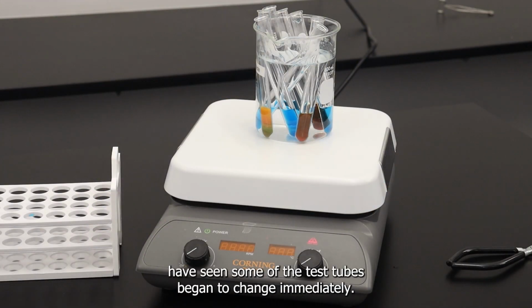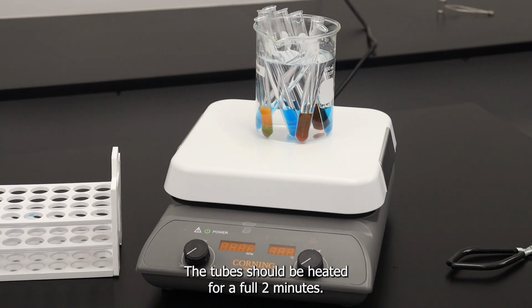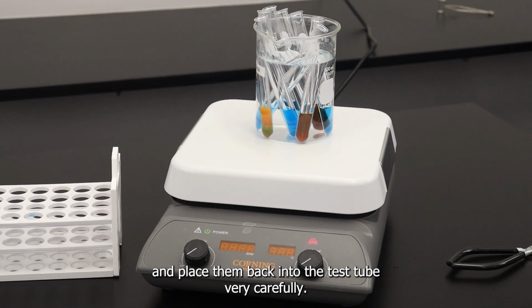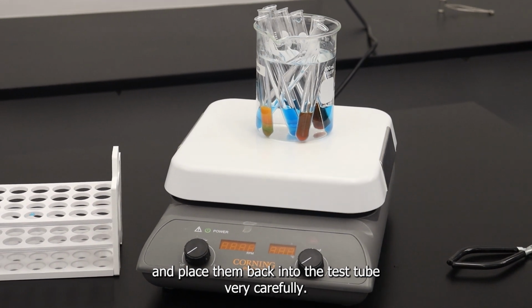You may have seen that some of the test tubes began to change immediately. The tubes should be heated for a full 2 minutes. We have completed our boil for the full 2 minutes, and now we can remove them using the test tube clamps and place them back into the test tube rack very carefully.